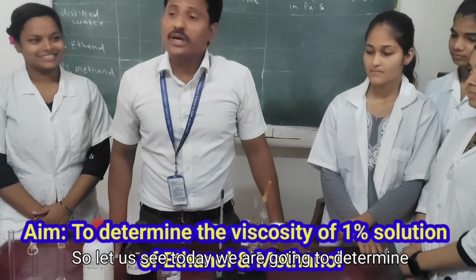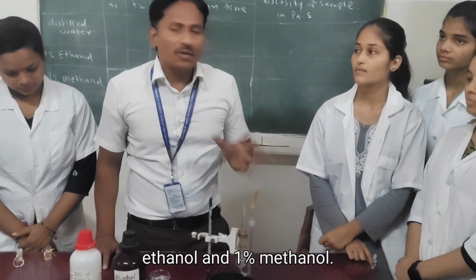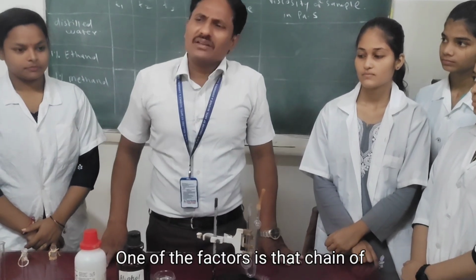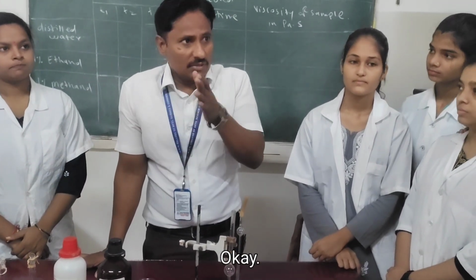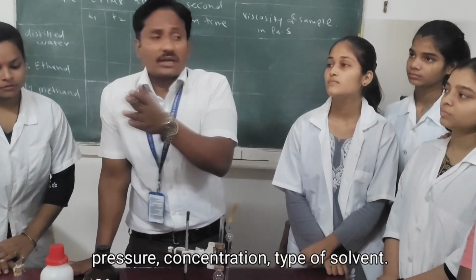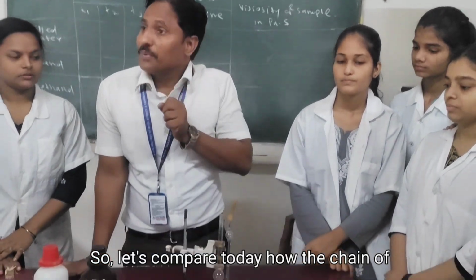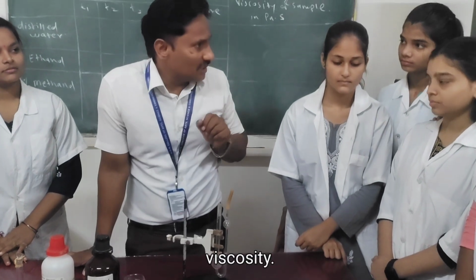So let us see, today we are going to determine the viscosity of 1% ethanol and 1% methanol. We know that a number of factors affect the viscosity: temperature, pressure, concentration, type of solvent, and one more, the chain of hydrocarbon. So today we will compare how the chain of hydrocarbon is going to affect the viscosity.